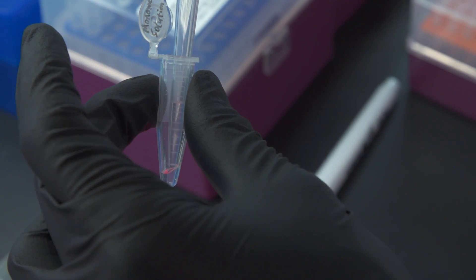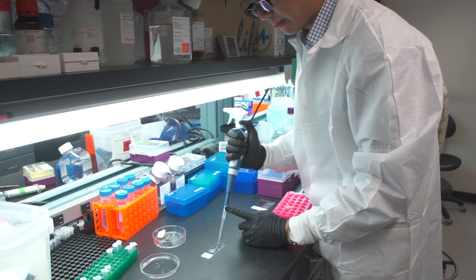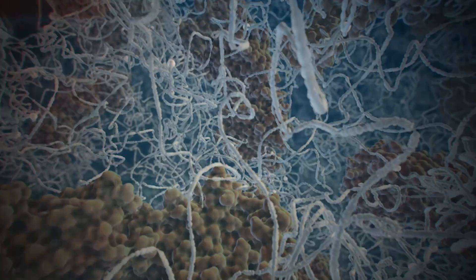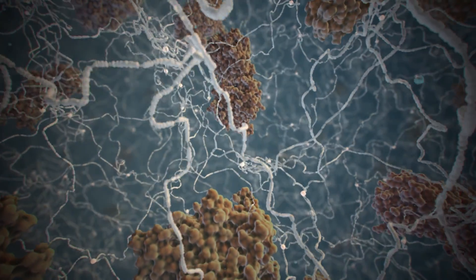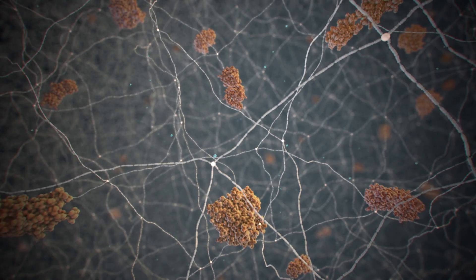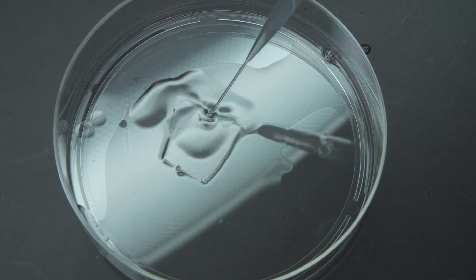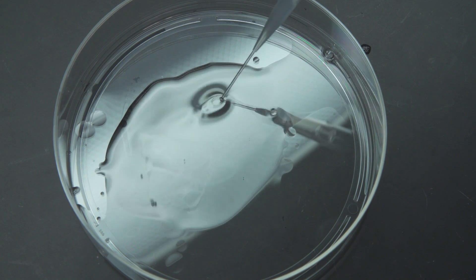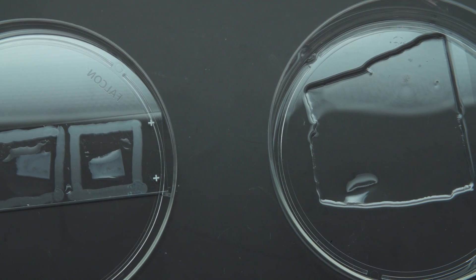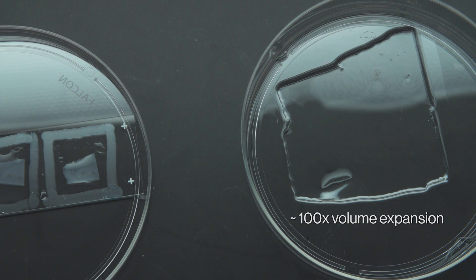In the second step, we color some protein of interest in the tissues. Then we apply small chemicals to further modify the tissue so that the molecules in the tissues would be attached to the gel network that we synthesize in the later step. Finally, we apply the treated tissue-gel hybrid into pure water.